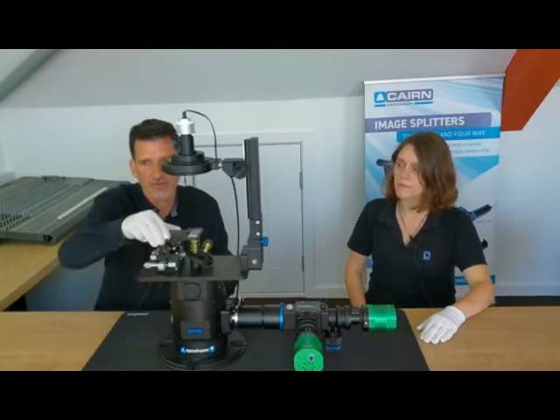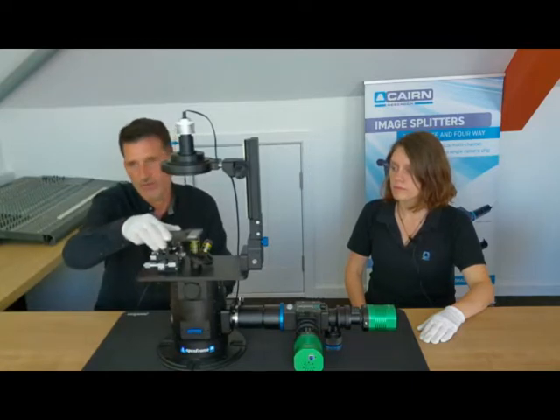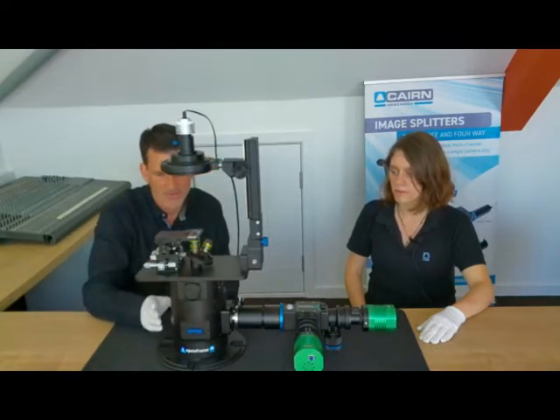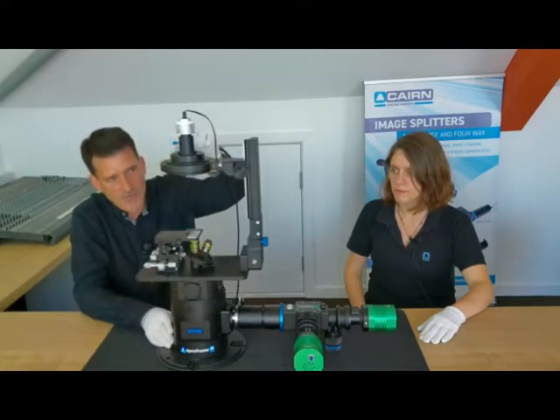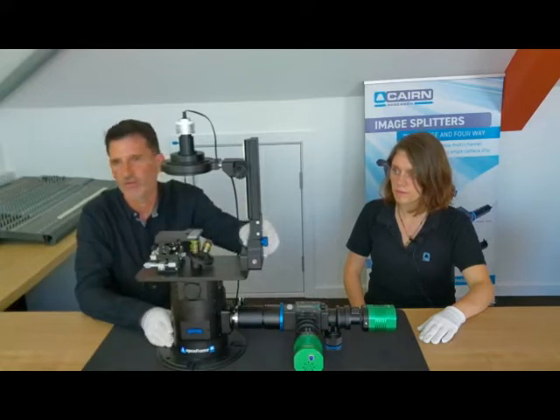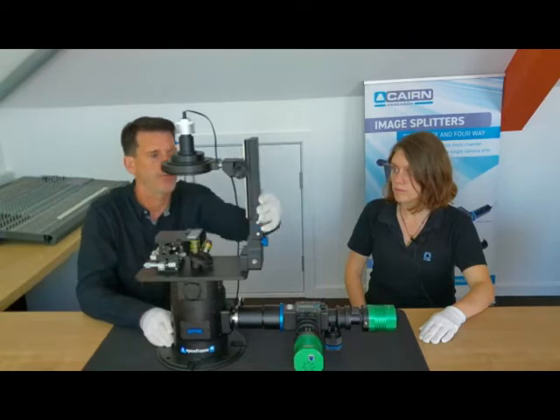We've also included this nice magnetic sliding mechanism so that you can pre-position the area of interest of the slide, so that you don't have to move the XY micrometers too far. This configuration is set up for transmitted illumination using our condenser-free Aura condenser, an LED-based phase ring illuminator. This device can do phase contrast and also dark field and conventional bright field, depending on whereabouts you position the phase ring on the pillar.